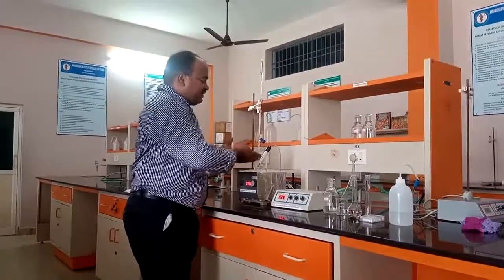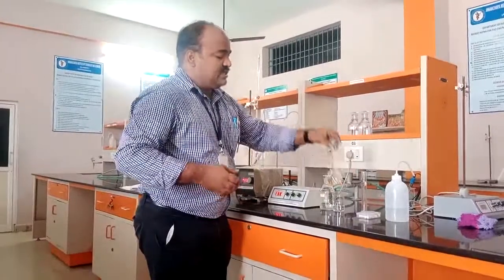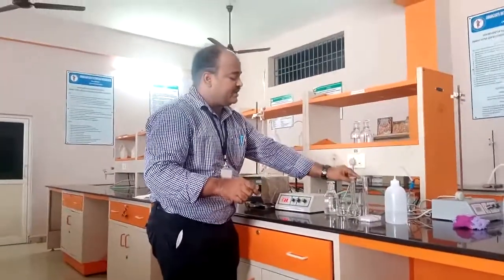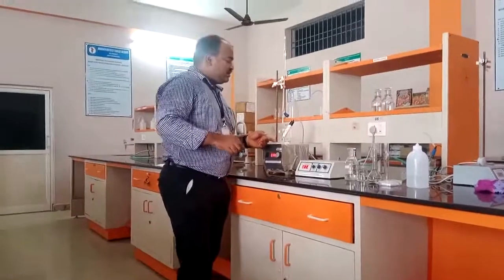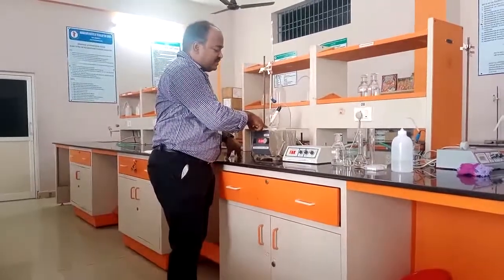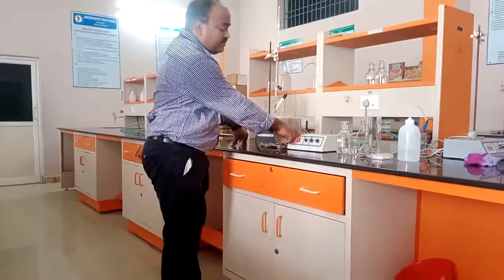Okay, that mixture which we have taken here, we will give you in the standard flask, 5 ml, that you need to make up until this mark. From this solution, you need to take 50 ml into this beaker. So when I keep this indicator electrode into this acid mixture solution, I have not added any NaOH. Then this is the conductometer.